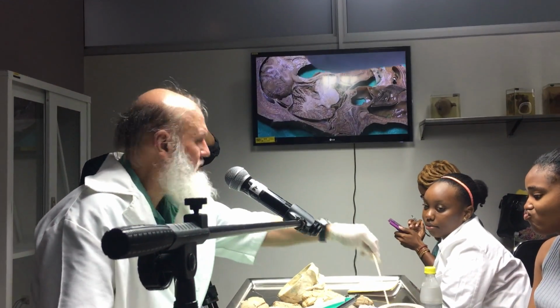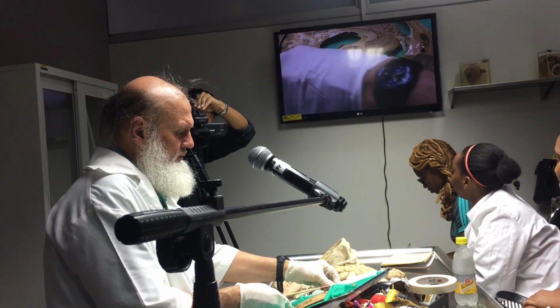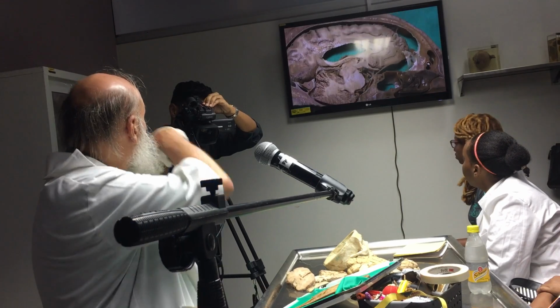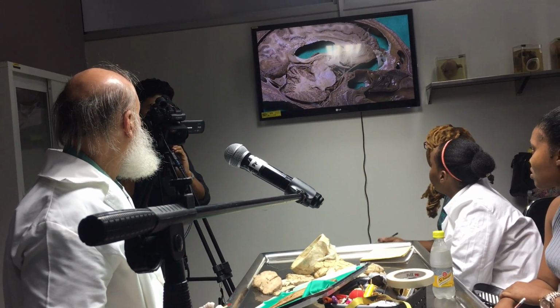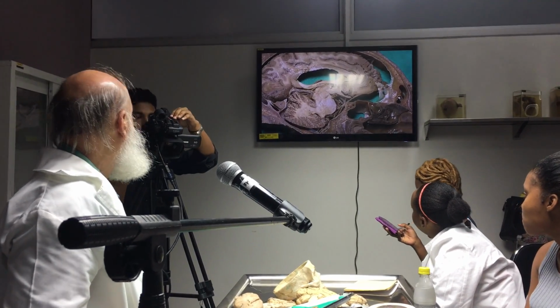Alright students, so look at this specimen here. Let us look right at this specimen. It's a nice specimen. Just focus on him right here.